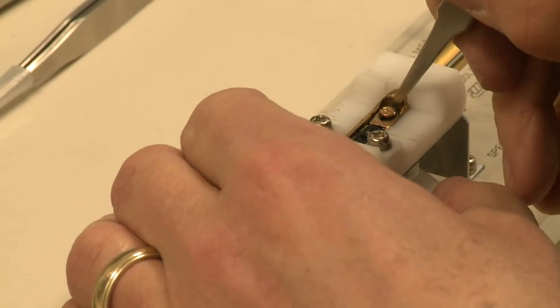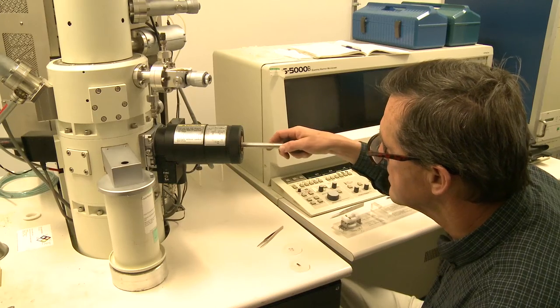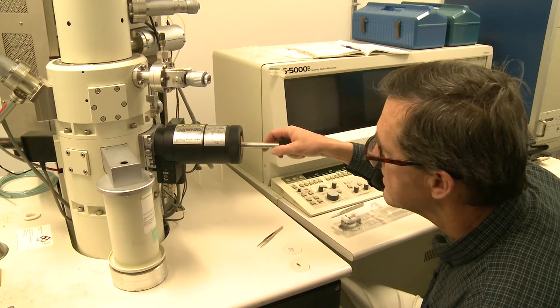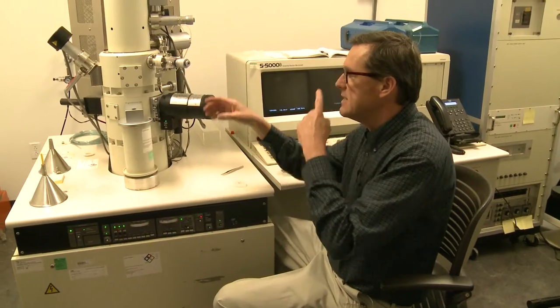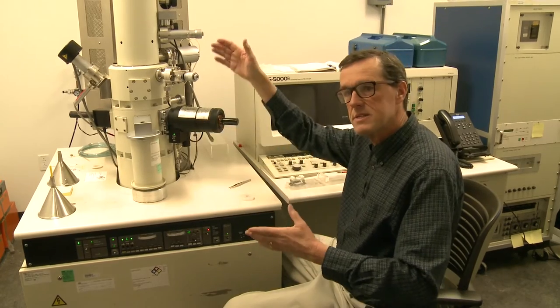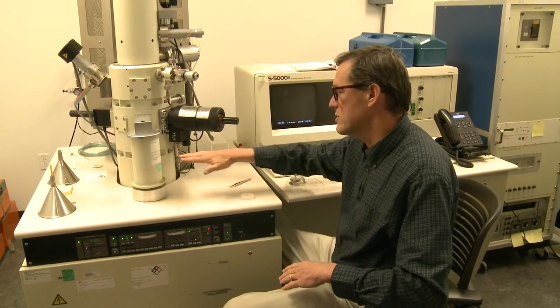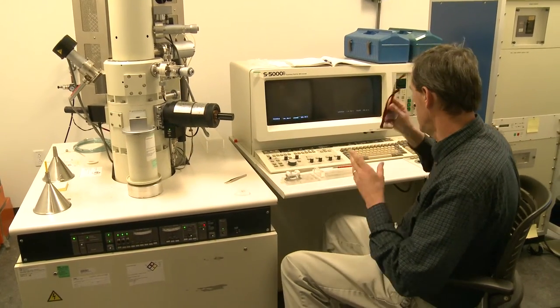We're blinking. I can now go all the way in. And now that sample is in the path of the electron beam as it's accelerated towards the bottom of the column.